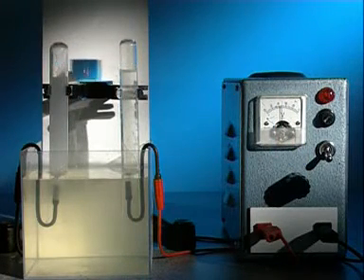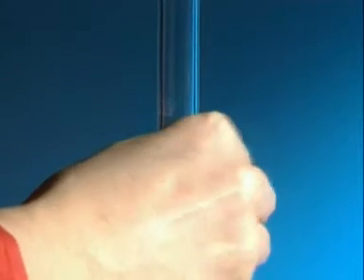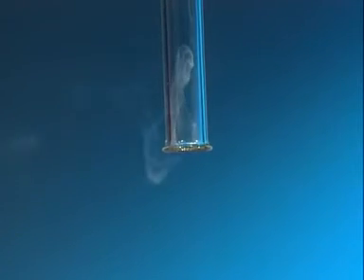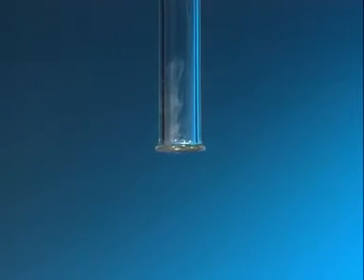The gas collecting at the negative electrode is tested with a lit splint. It pops, a sure sign that this gas is hydrogen.